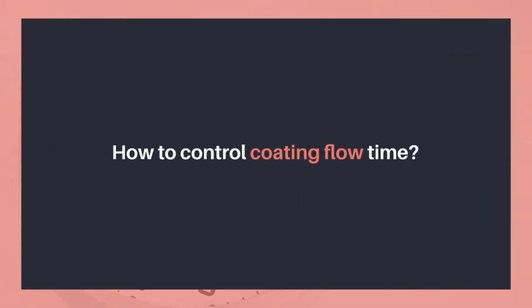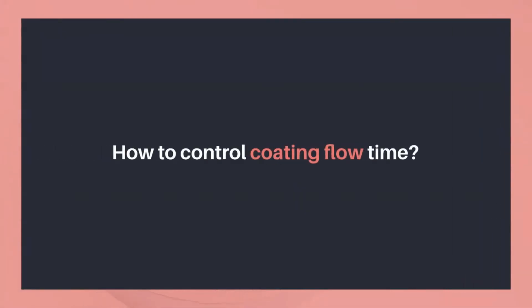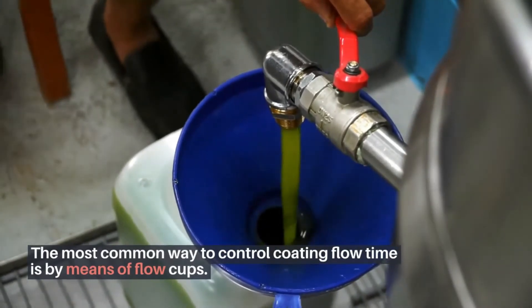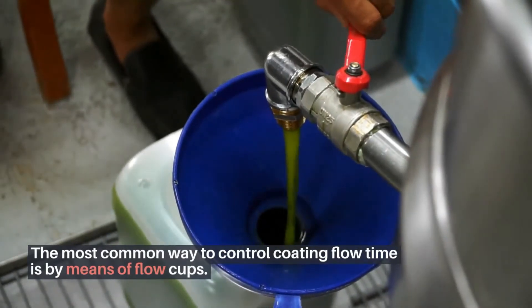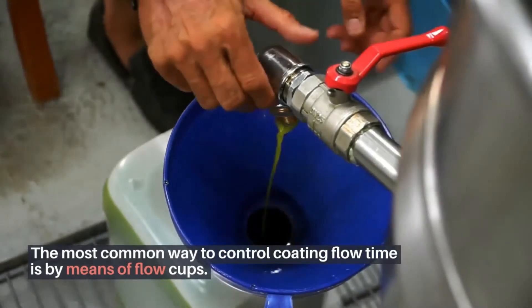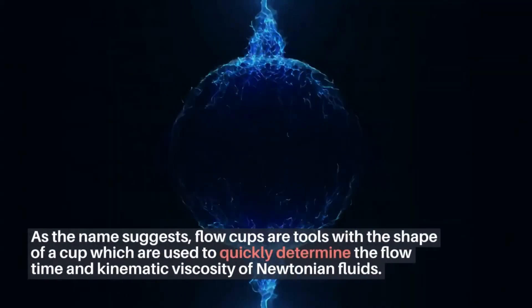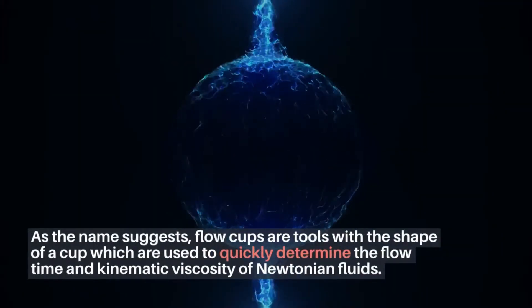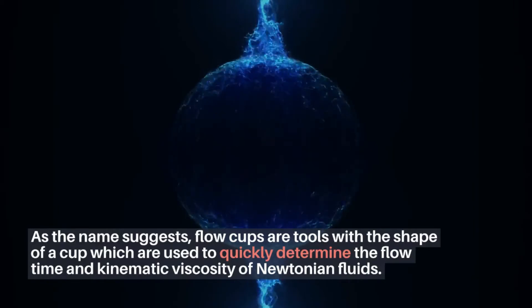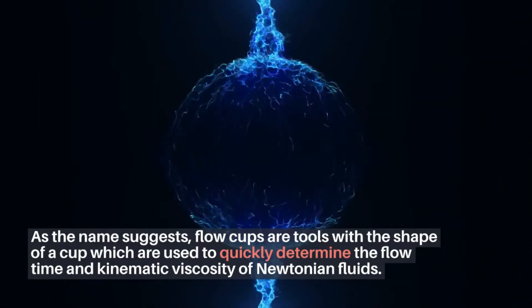How to control coating flow time. The most common way to control coating flow time is by means of flow cups. As the name suggests, flow cups are tools with the shape of a cup which are used to quickly determine the flow time and kinematic viscosity of Newtonian fluids.